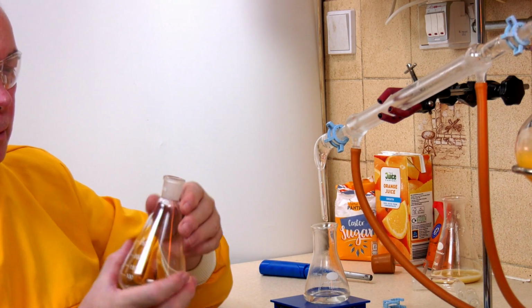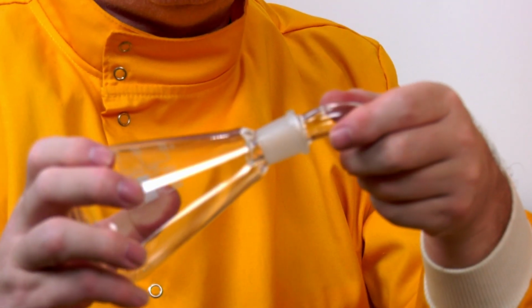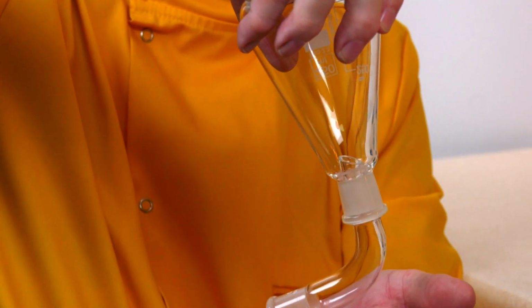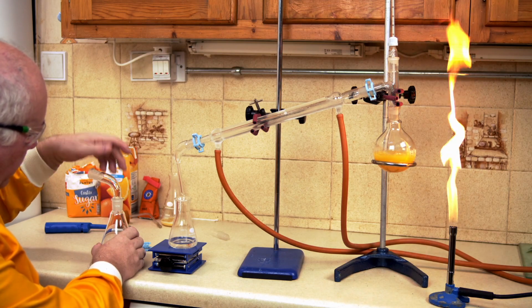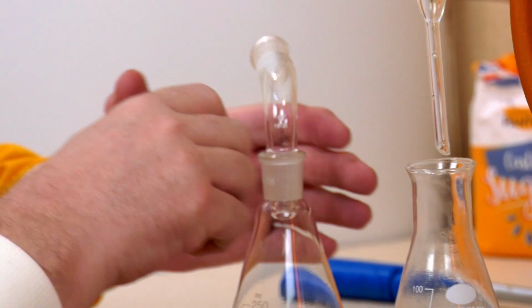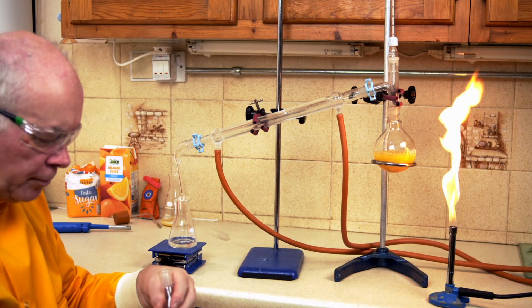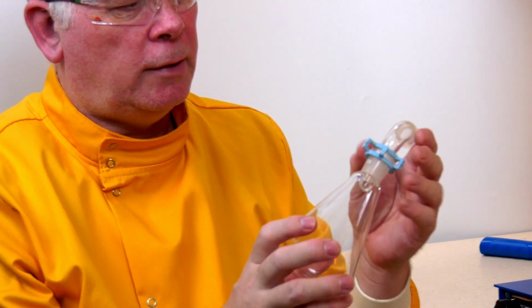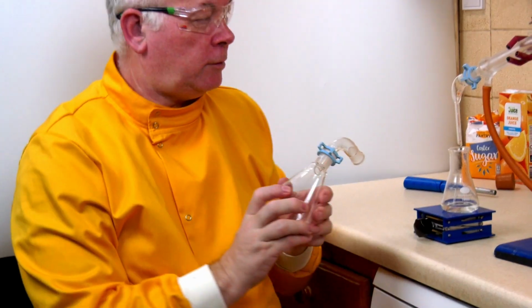While waiting for that, this is Quickfit. All the glass is joined, so we've got these ground glass joints, and we push one in to the other, and if we twist very slightly, then it stays joined. I wouldn't really recommend doing that. What we normally do to fix things properly is we put them in, and then we've got these special clips, and if I push the clip on very gently, then this will grip the top piece and the bottom piece. They're different sizes. In this case, the bottom one is 26 and the top one is 19 millimeters. This will still move, but now it is really firm and can't escape.